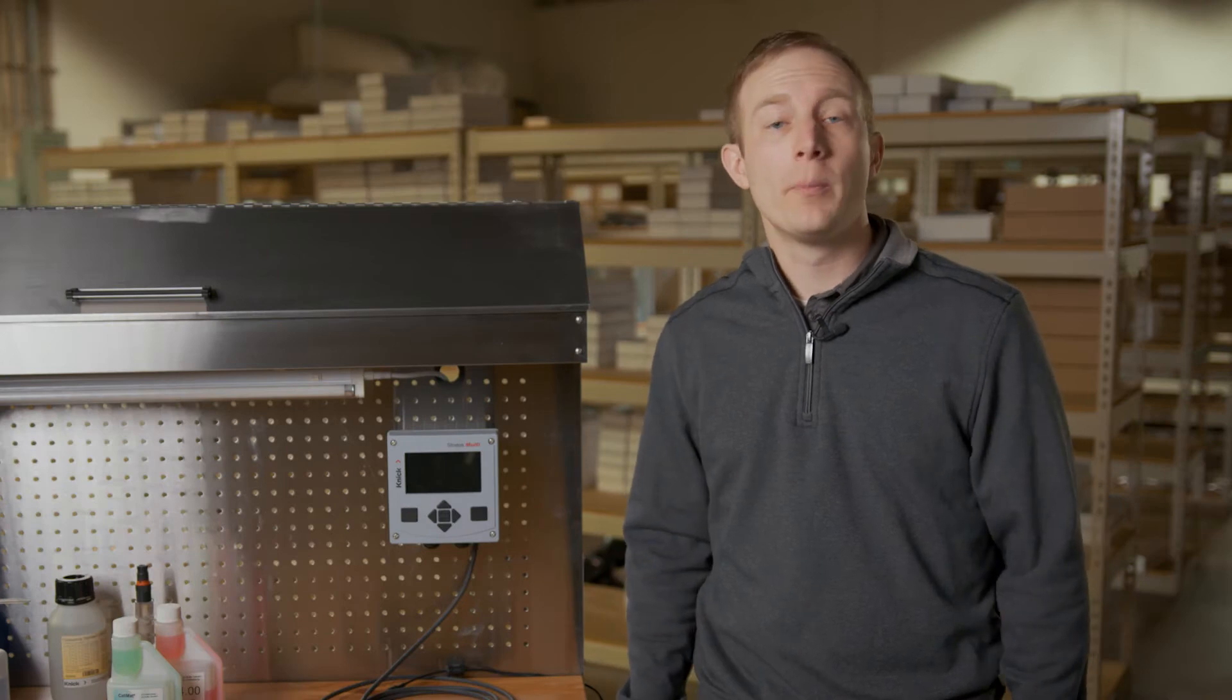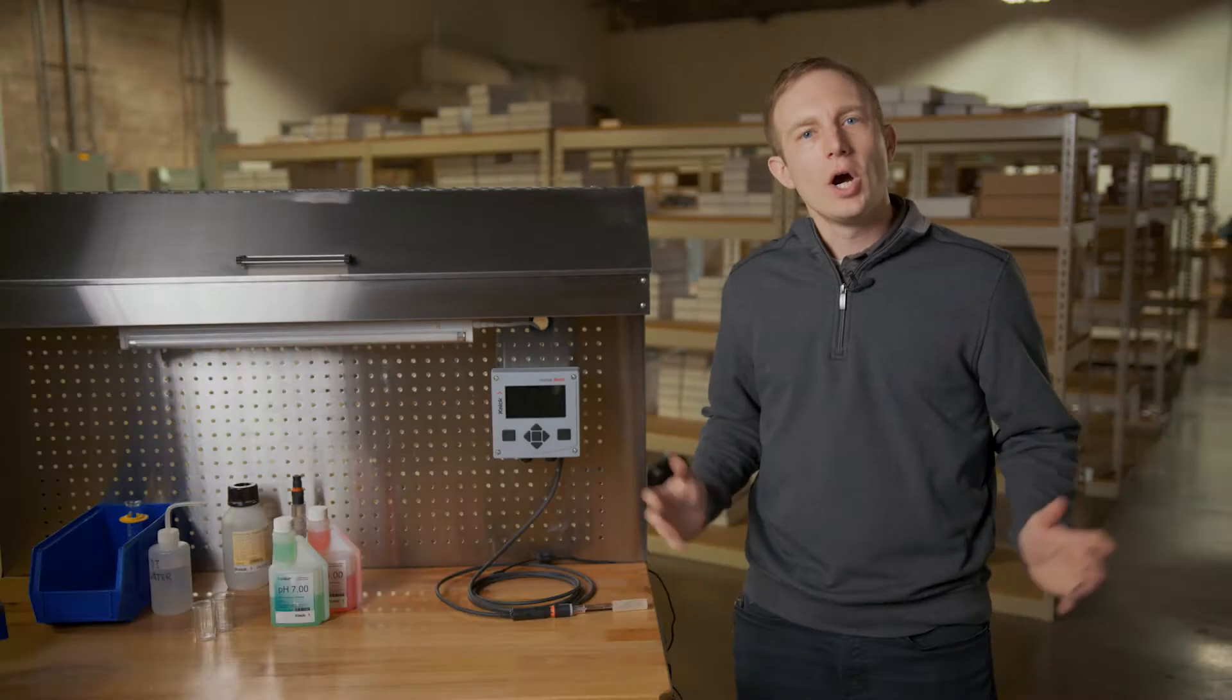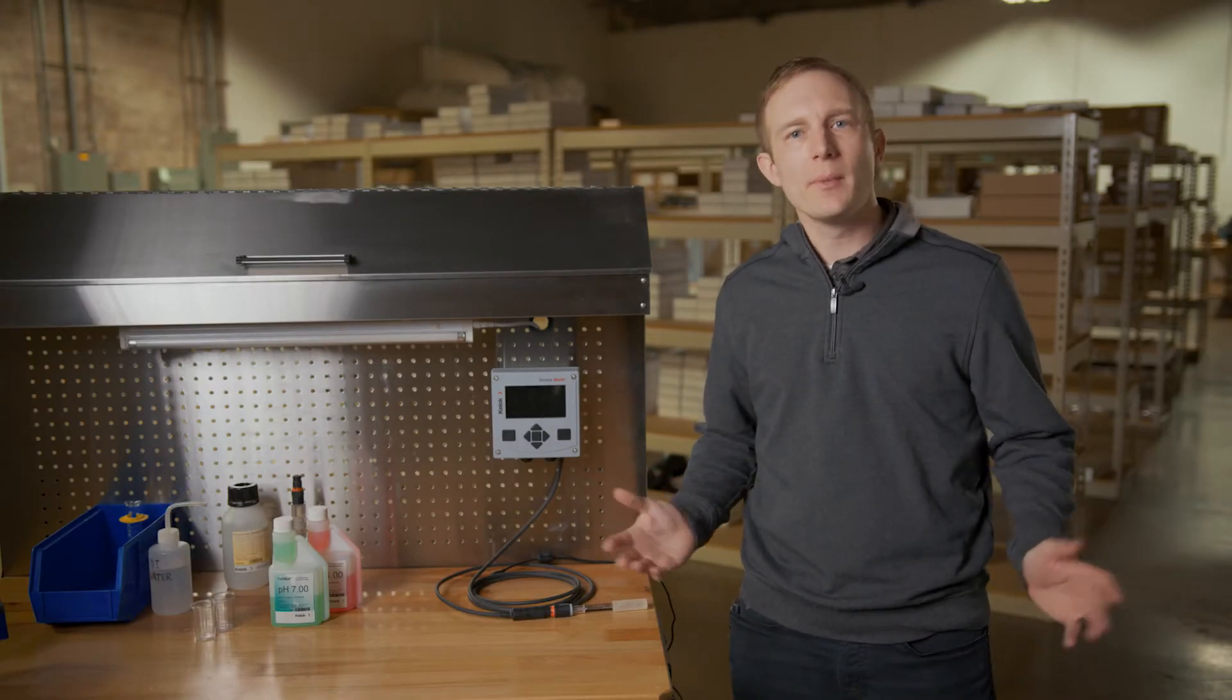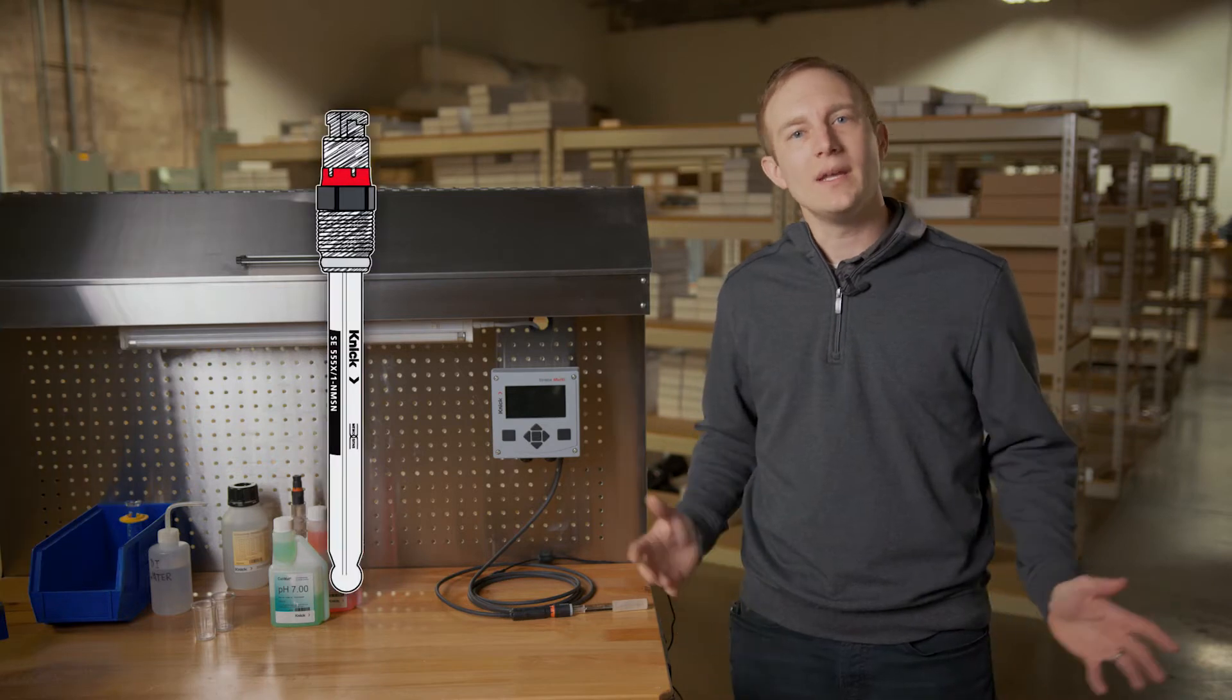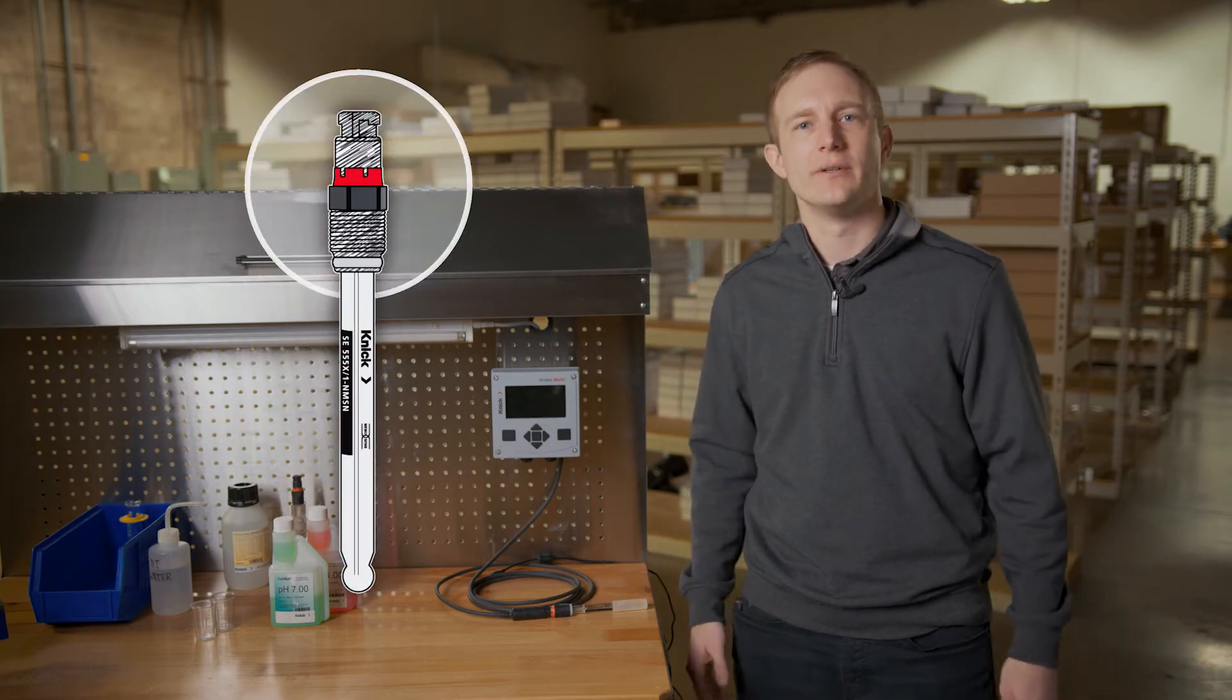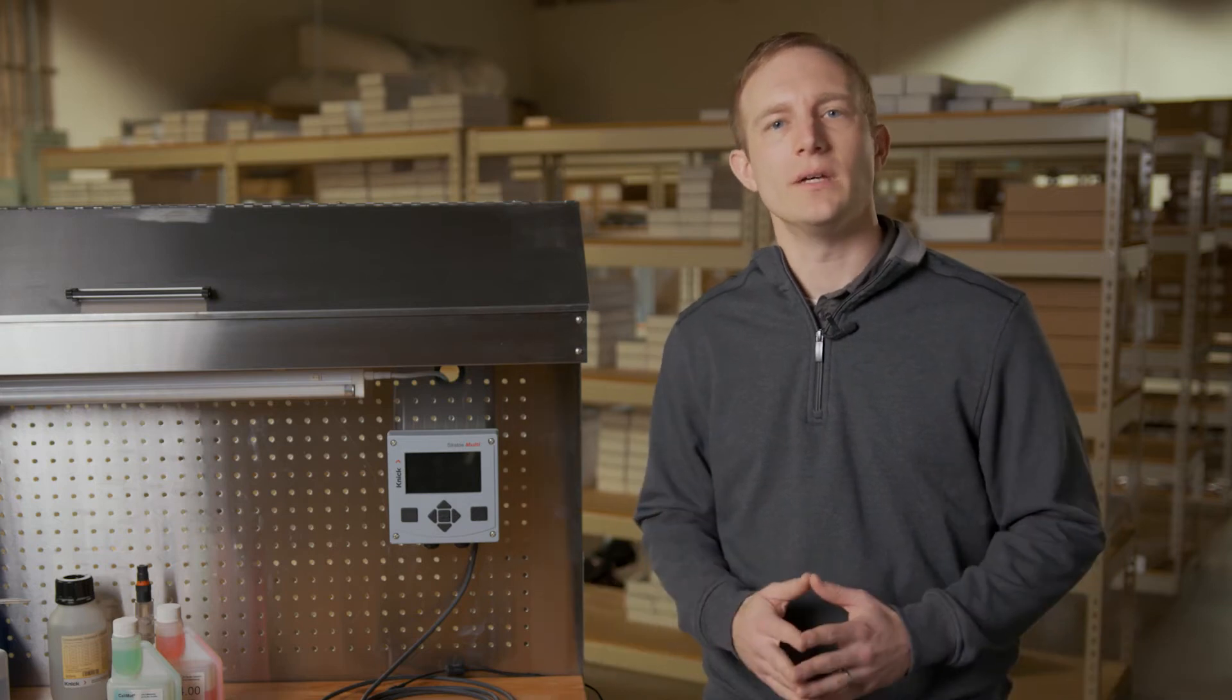The calibration will be performed offline in a controlled environment right here in our workshop. Our connected pH sensor is a MemoSense smart digital sensor. The calibration will be written and stored in the head of the sensor. These steps however can also be utilized when performing a calibration in the field.